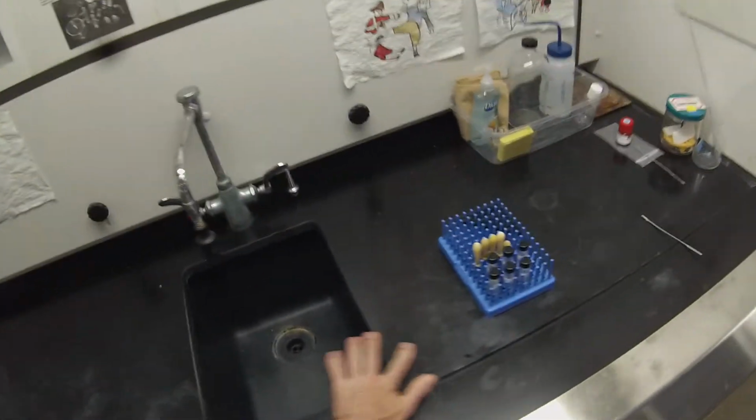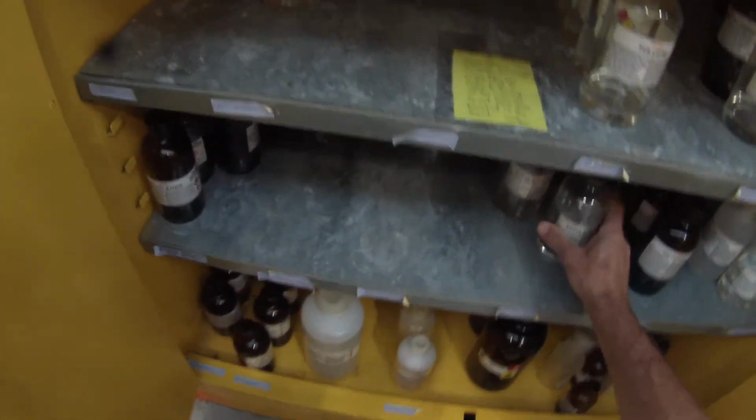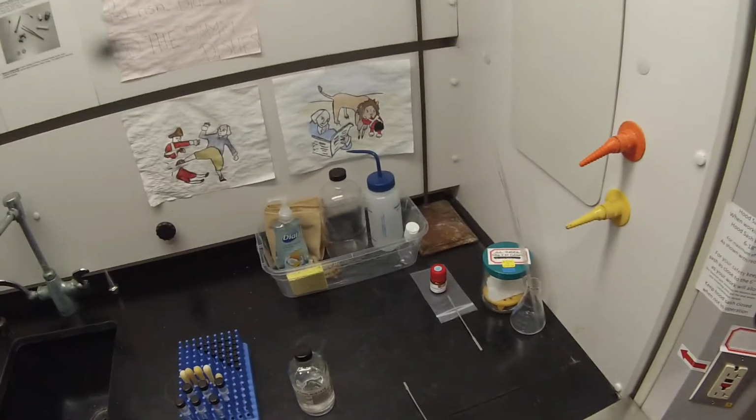The solvent I'm going to use to dissolve these is ethyl acetate. I'm relatively certain they'll all be freely soluble in ethyl acetate. And ethyl acetate is one of the components of the thin layer chromatography solvent mixture that we're going to use to analyze them. And I'm just going to turn off the camera for now because I need to go to the stockroom and get an automatic pipetter.